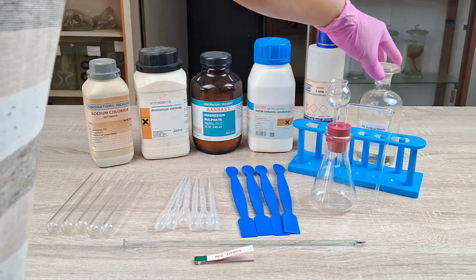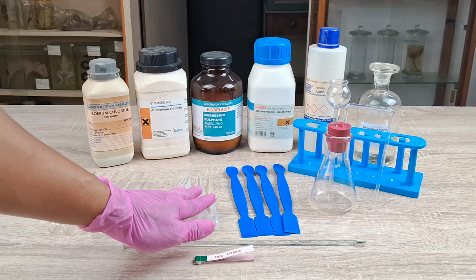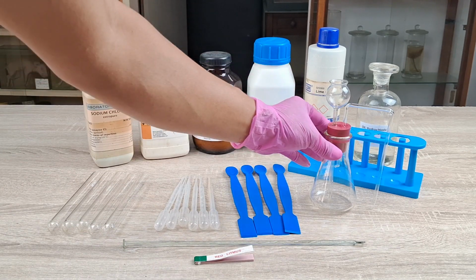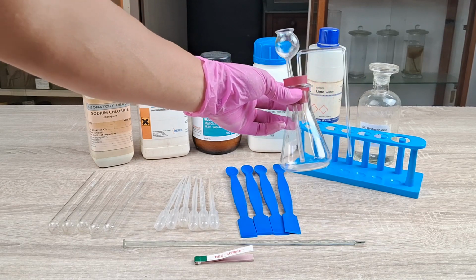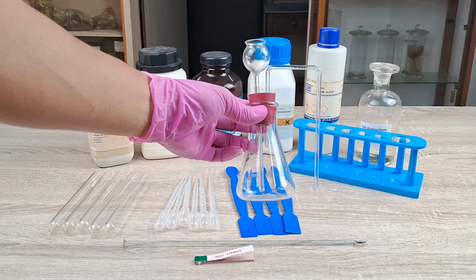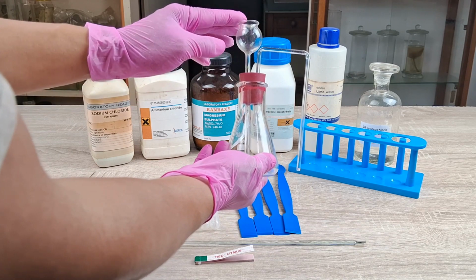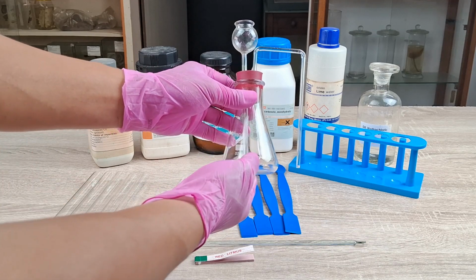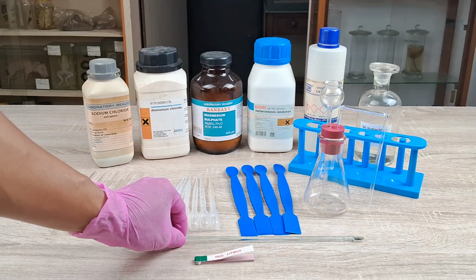lime water, dilute hydrochloric acid, 5 test tubes, 6 droppers or pipettes, 4 spatulas, a test tube stand, a simple apparatus consisting of a wide-mouth 100 ml Erlenmeyer flask fitted with a 2-hole rubber cork, a thistle funnel and a delivery tube bent at right angles in 2 places are fitted into the 2 holes of the cork as shown here. You may also use a 25 by 150 mm wide-mouth test tube in place of the Erlenmeyer flask. A glass rod.